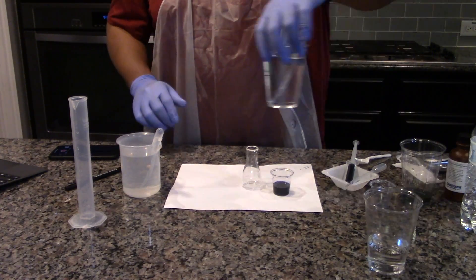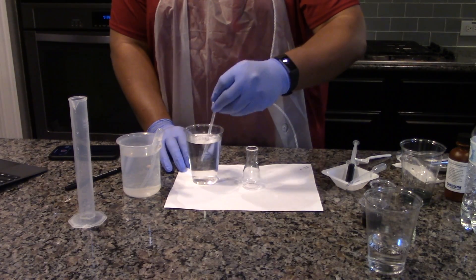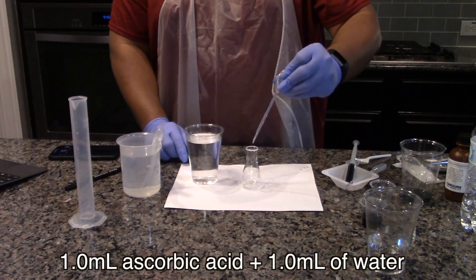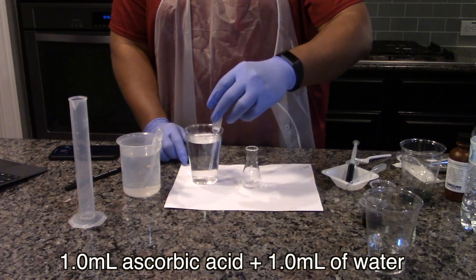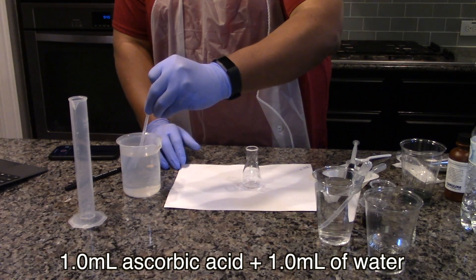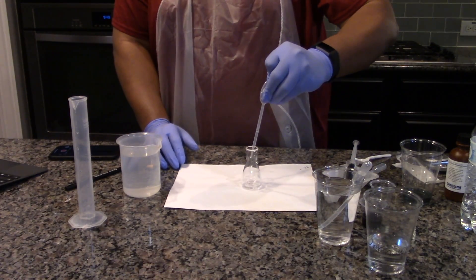Now perform the titration for the 1.0 gram per liter sample. Transfer 1 mL of the ascorbic acid stock solution to the flask and add 1 mL of pure water to the flask. Perform the titration using the same steps as above.